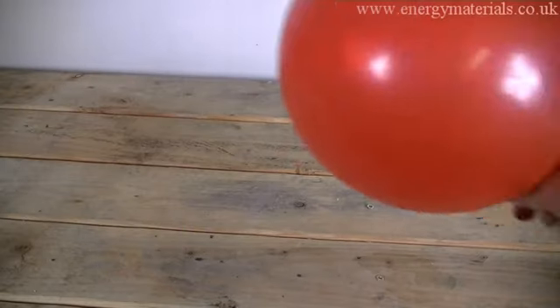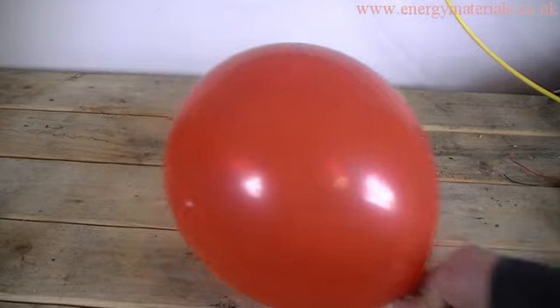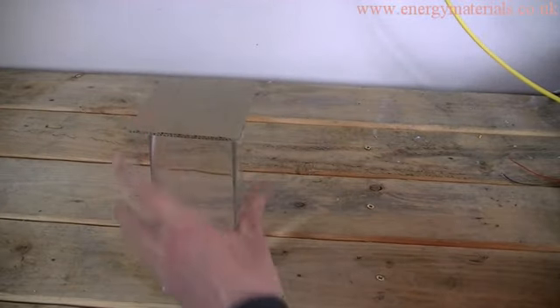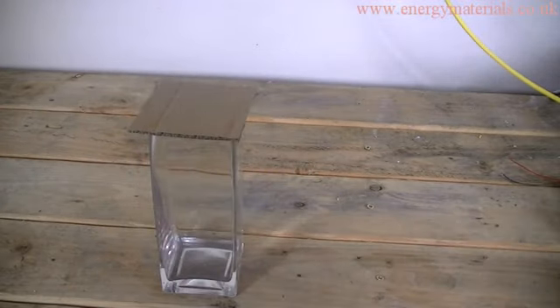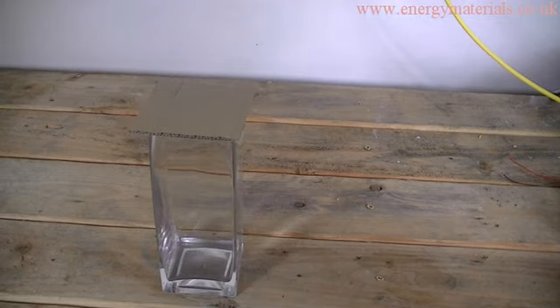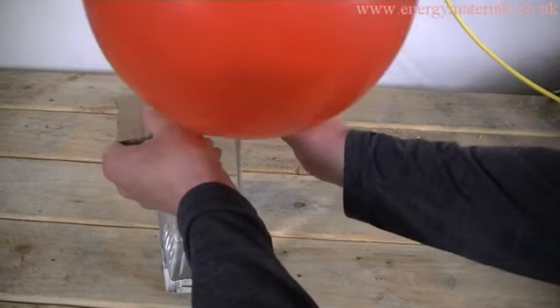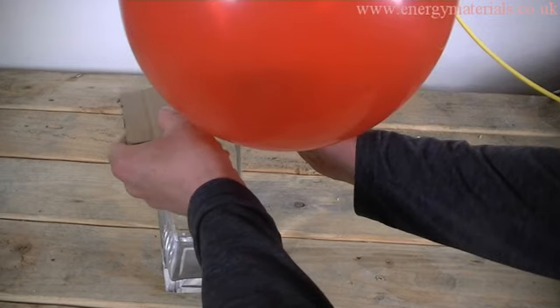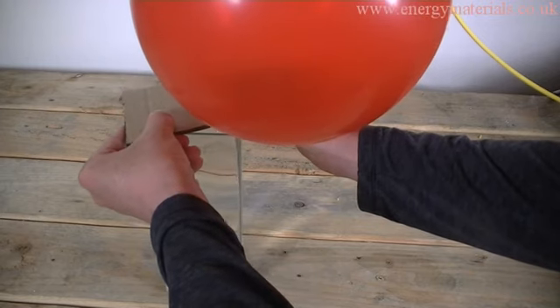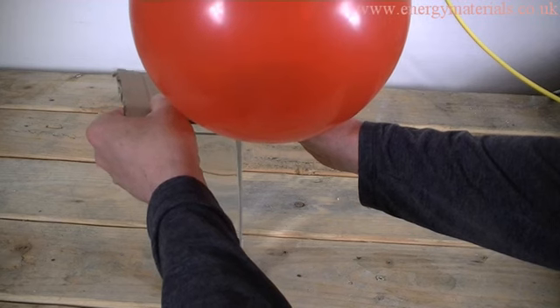One of the demonstrations you can do to show that carbon dioxide is heavier than air is to fill a container with carbon dioxide. In this case we are using a vase. To fill the vase with carbon dioxide, we take a balloon containing carbon dioxide and empty it into the vase.